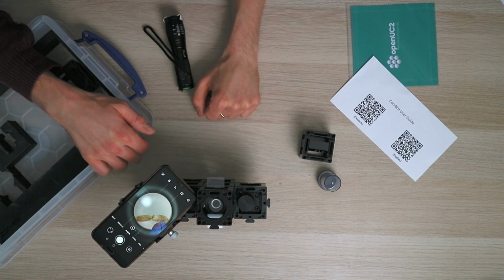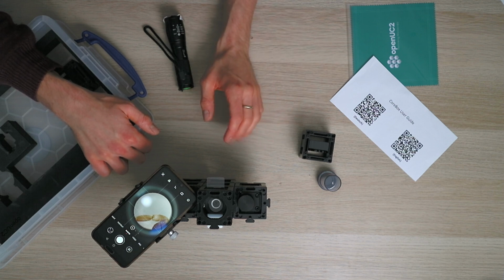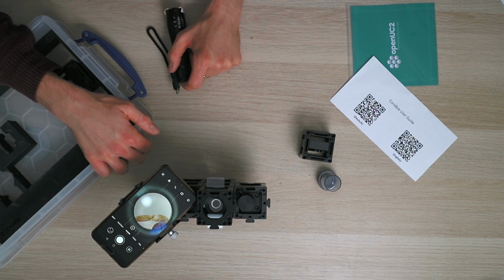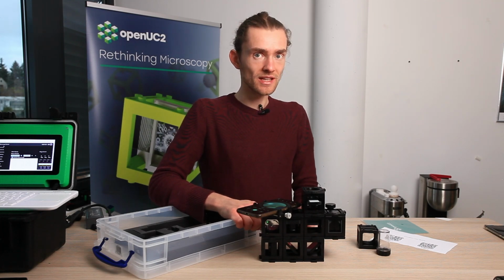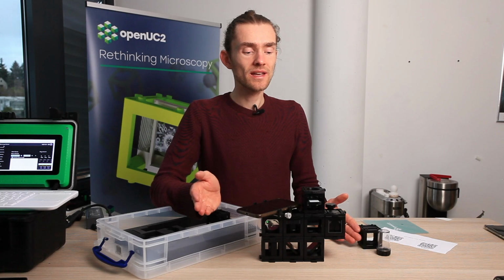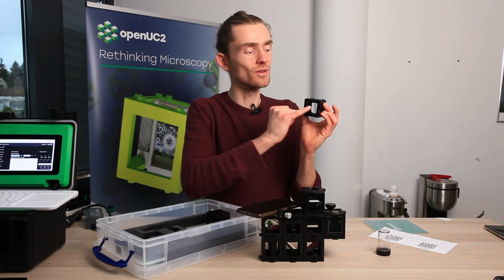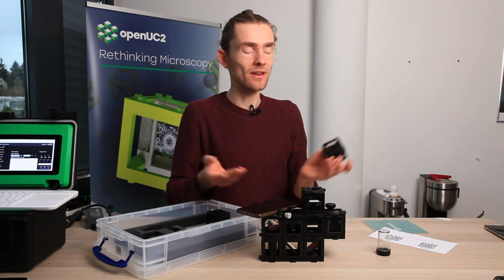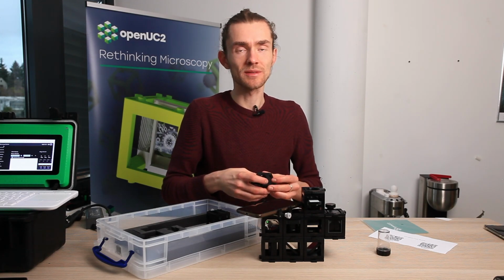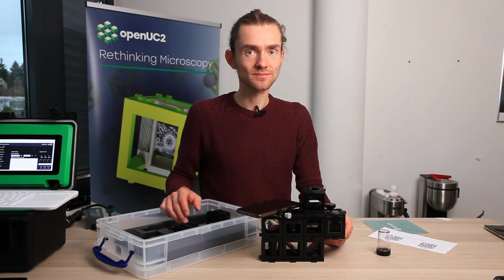Here we have a 4x lens that can image something up to the resolution of, say, somewhere between 5 and 10 micrometer. And with better lenses, you get better images. And it's not only the magnification that matters in terms of resolution. What matters in the end is the so-called numerical aperture. So it's basically how much light and information you can collect through the finite aperture of the lens. So the wider or like the bigger diameter you have from the lens, the more information you can collect theoretically. And then also the higher the resolution can be that you can acquire with both your eye and also the camera sensor. And that's it.